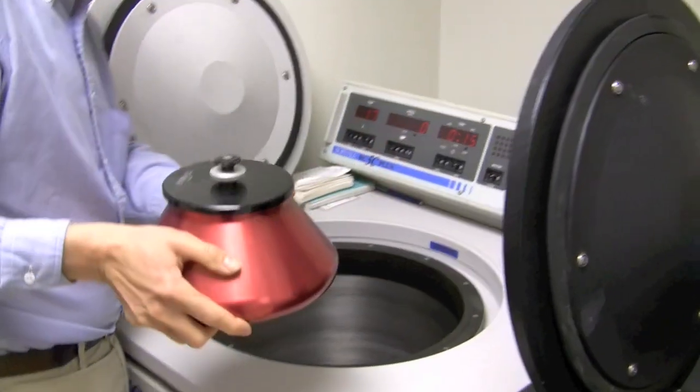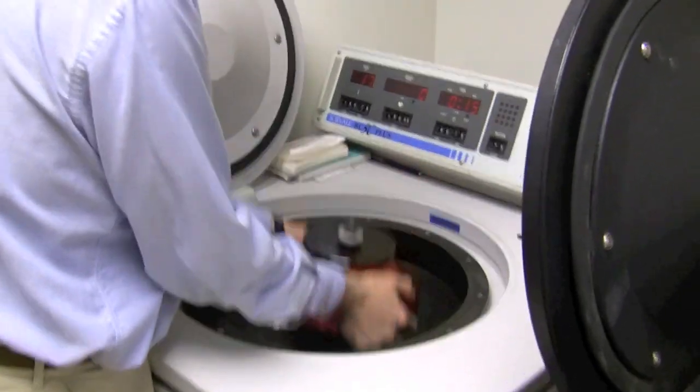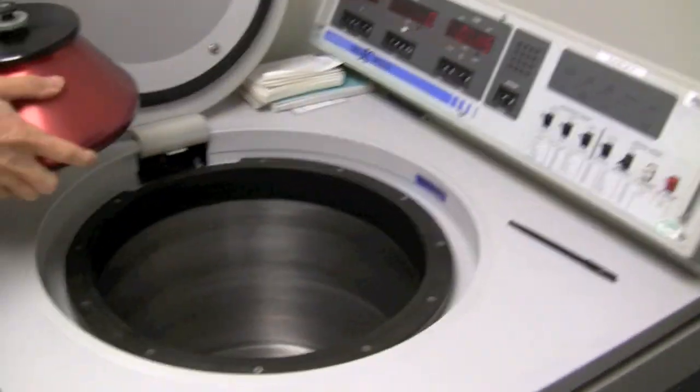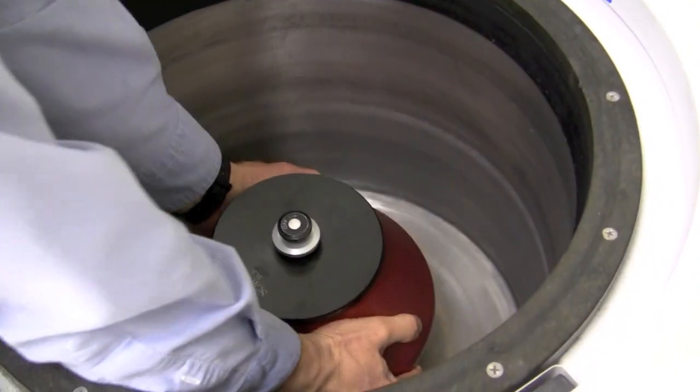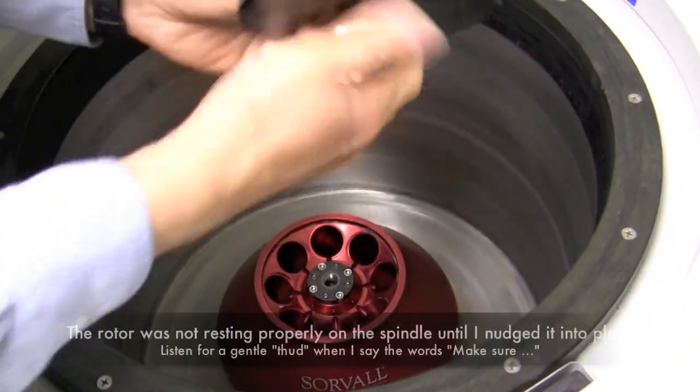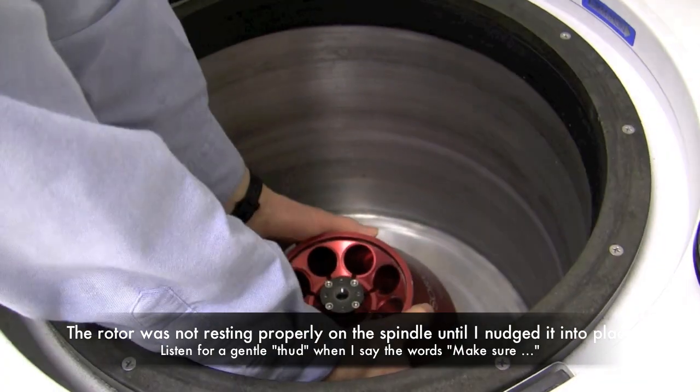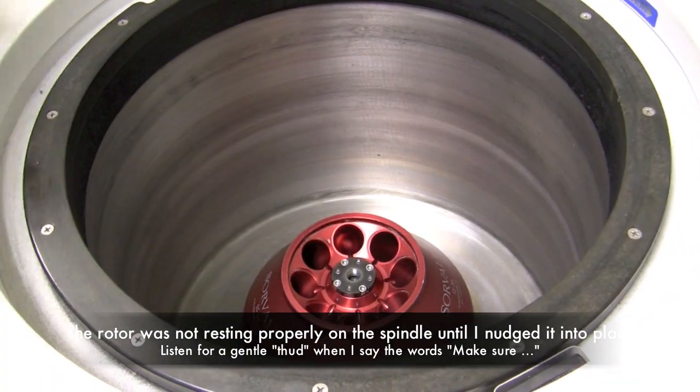So I hold it with two hands and I lower it gently onto the spindle. Okay, and make sure it actually rests properly.